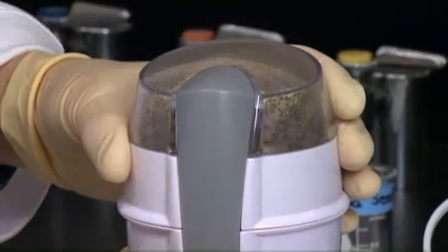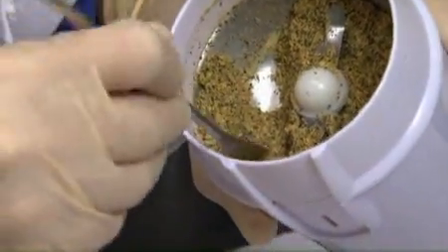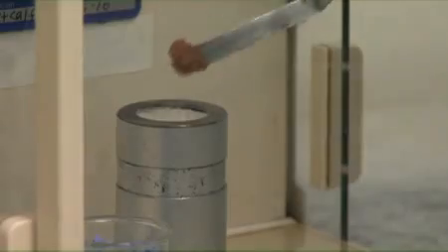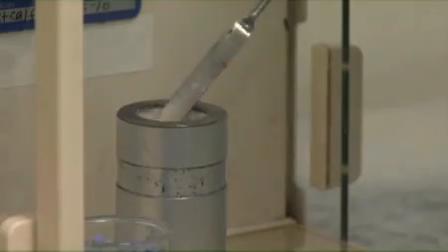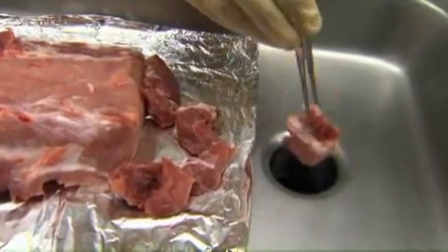Homogenization is achieved by finely grinding and blending the solid samples and vigorously shaking and mixing the liquid samples. Homogenization ensures that all of the sample material will be of consistent content throughout. In other words, the same test results would ideally be achieved regardless of which portion of the sample is used. As a general rule, it is advisable to process the entire submitted sample when possible.